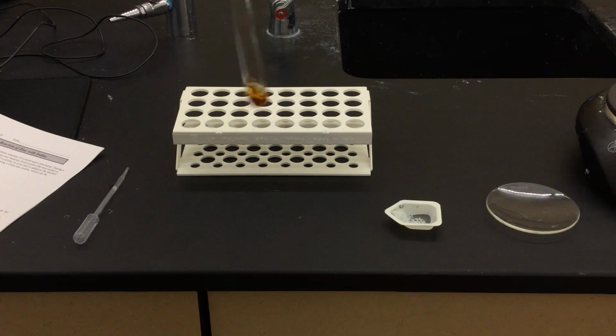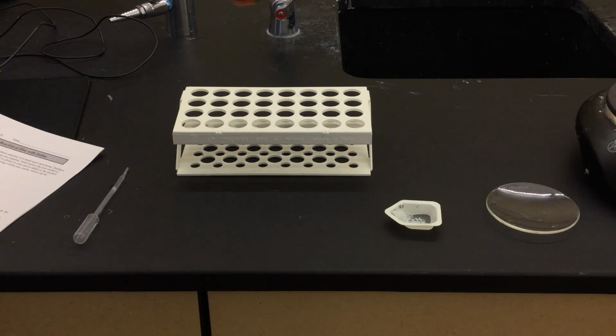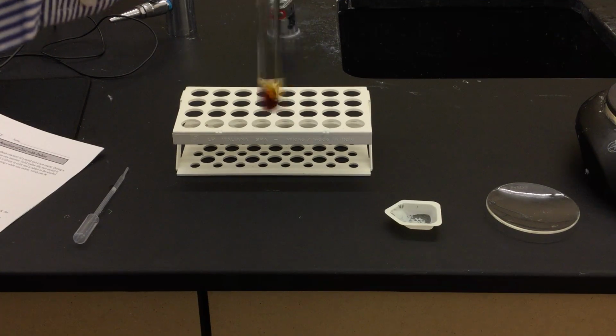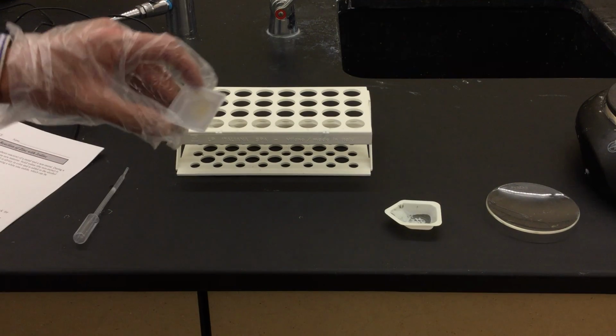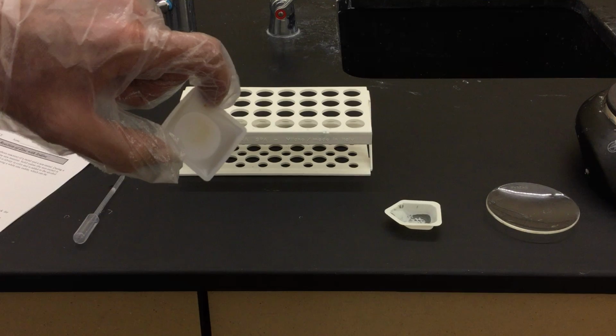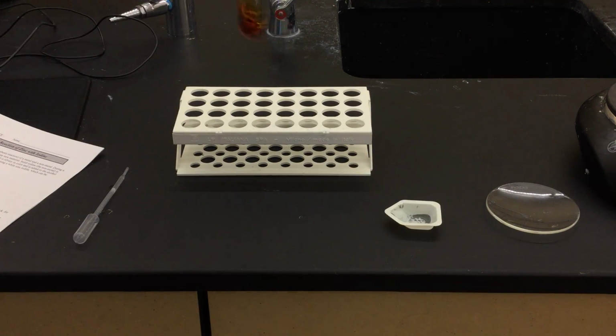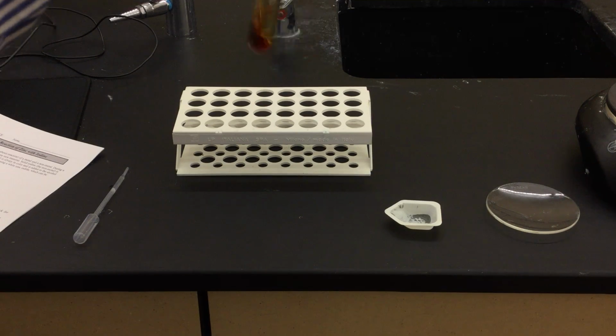The iodine is a kind of a purplish, silvery color. And now this is becoming a yellow-orange or even slight reddish-brown coloration as well. So there's no chemical reaction that's taking place right now. This is actually just the iodine dissolving, very much like the iodine that you can see here, which was going into the plastic tray. So that's what's happening right now, is this is just dissolving.